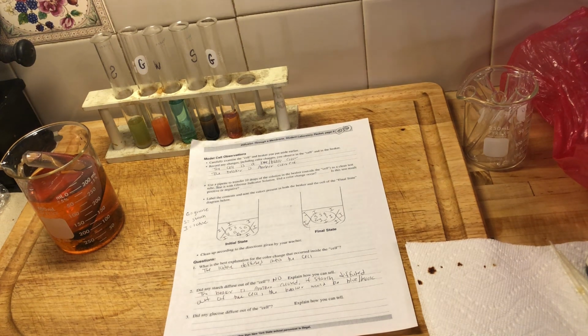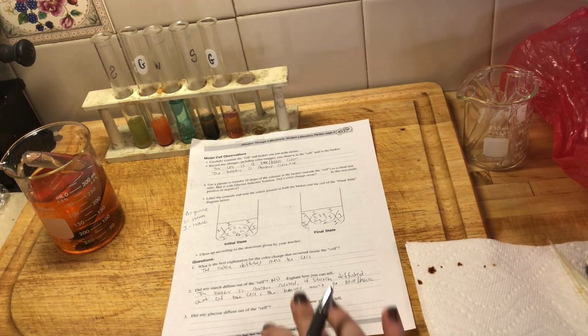I turned the water off, so it's a little slow going here. We're getting the burner going again to make it warm enough. So bear with me here. Let's see if we can move on to some other questions. So we can kind of skip here while we wait.